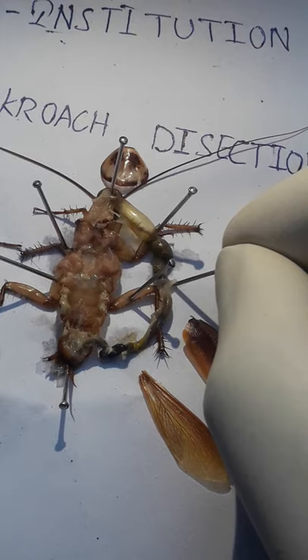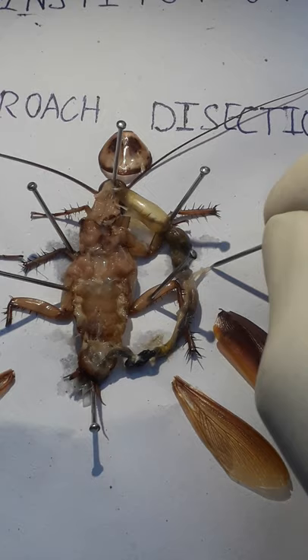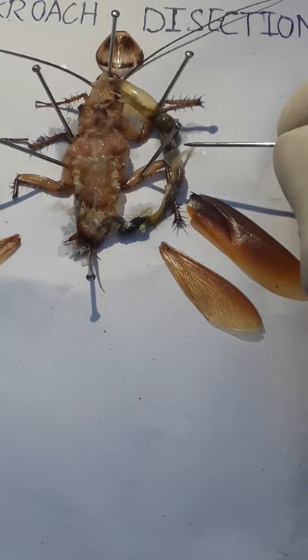You can see these finger-like projections — I am showing them to you. These are the hepatic caeca, and there are many such structures present at this ending region. These are referred to as hepatic structures.